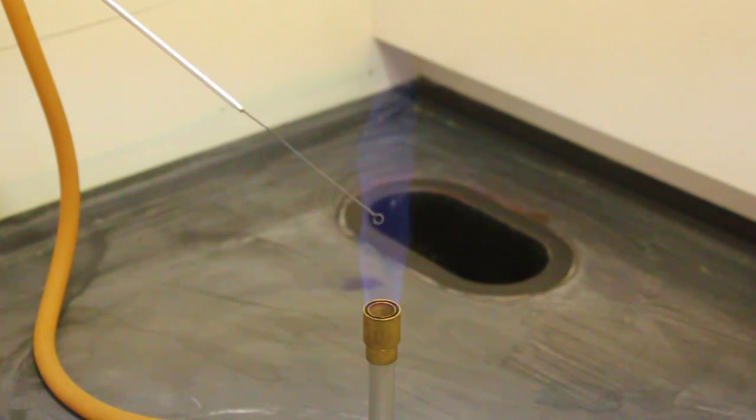After you have used an inoculating loop and it is no longer sterile, to re-sterilize the loop, you do it in the opposite direction.